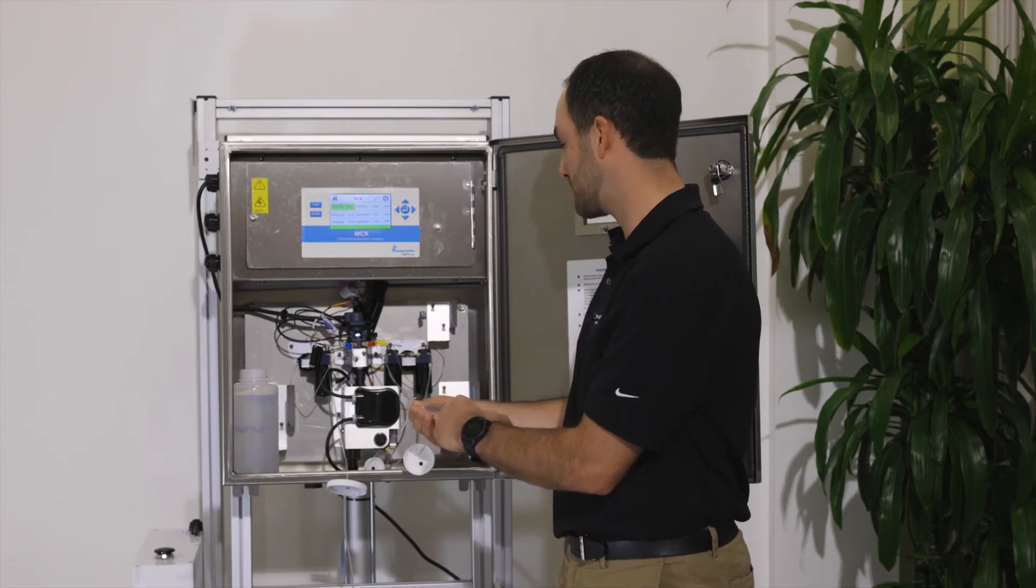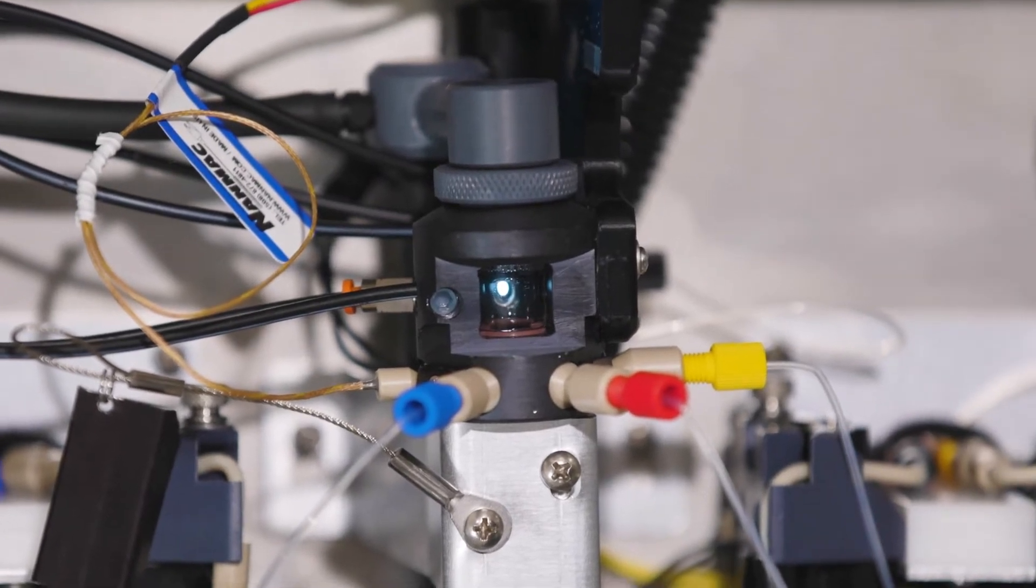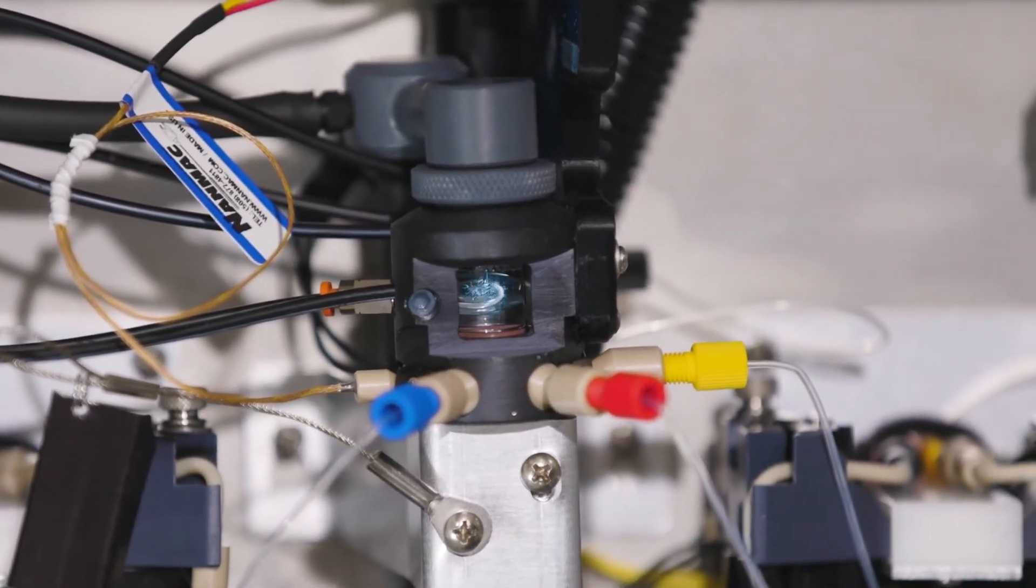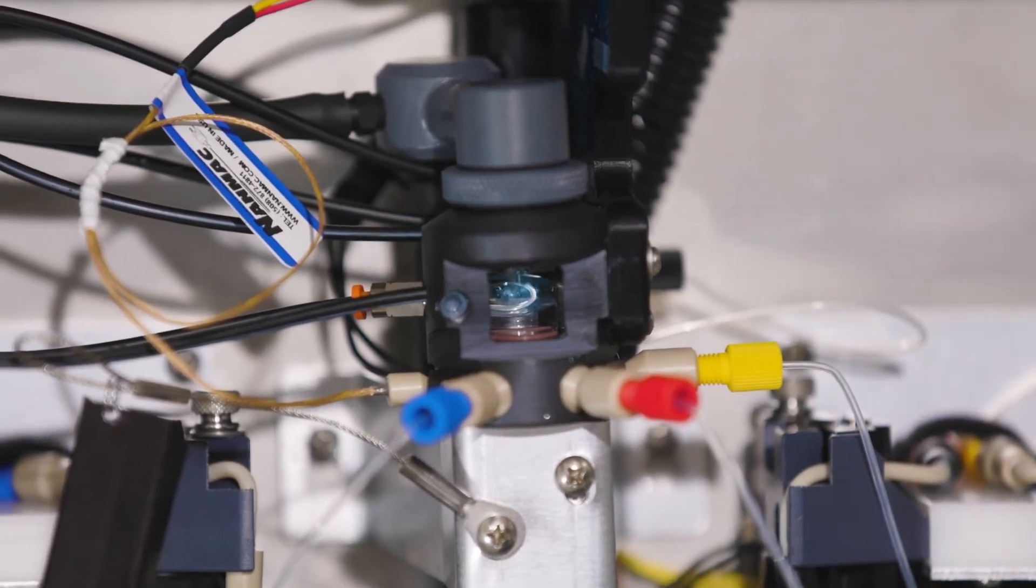So be careful as you're pushing to just put very even pressure on it. Again, make sure that your optical block is filling up. You can see the water going through. We're checking all of our connections to make sure there are no leaks.